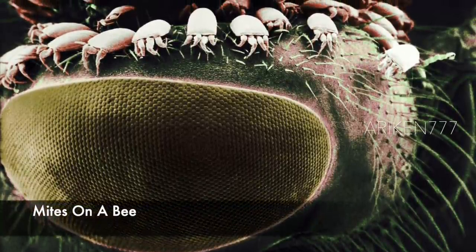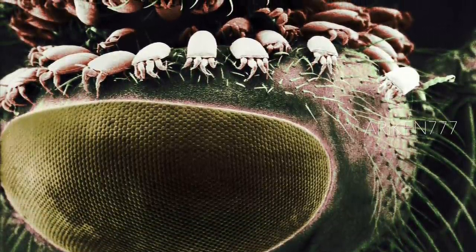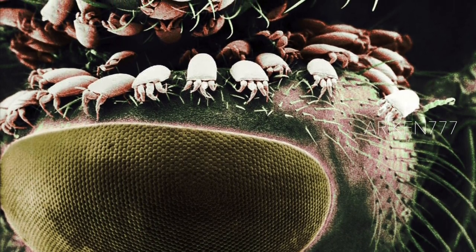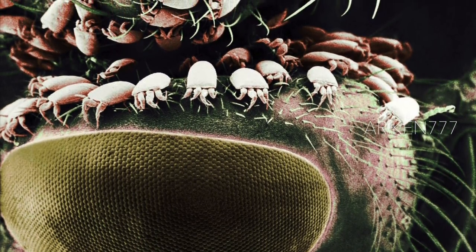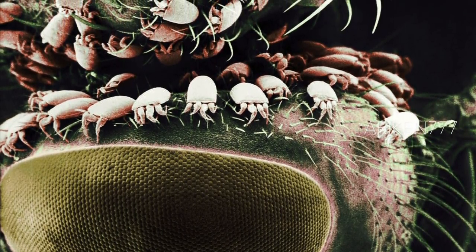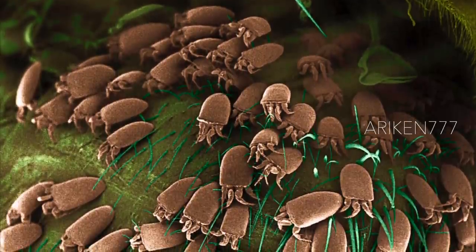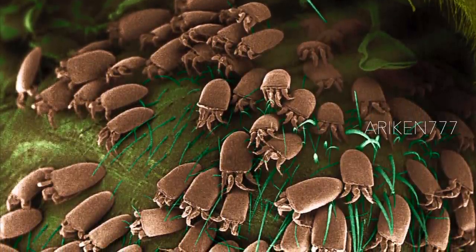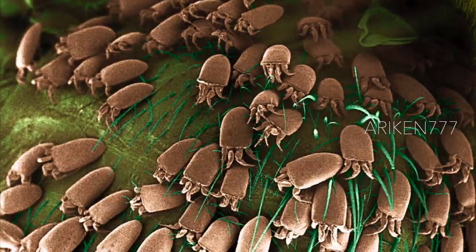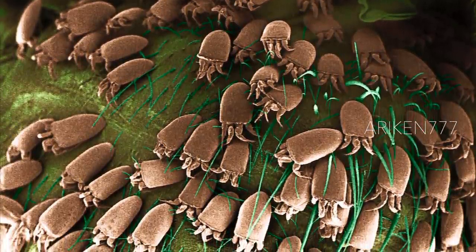Mites on a honey bee. The bee's compound eye is seen here at lower left. These mites are relatives of ticks and spiders and are parasites of the bee. They feed by cutting into the surface membranes of the bee. In large numbers, they can devastate colonies of bees, which is of particular concern since bees are often agriculturally very important as both pollinators and honey producers.